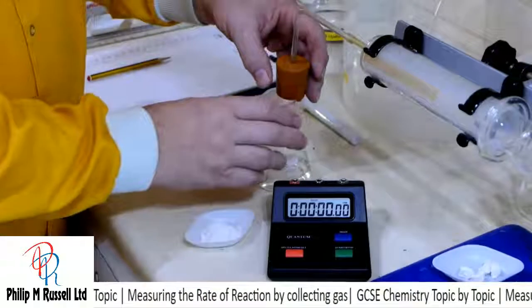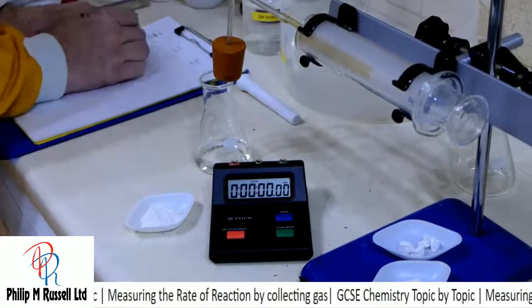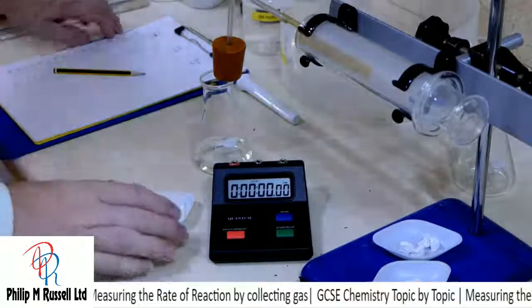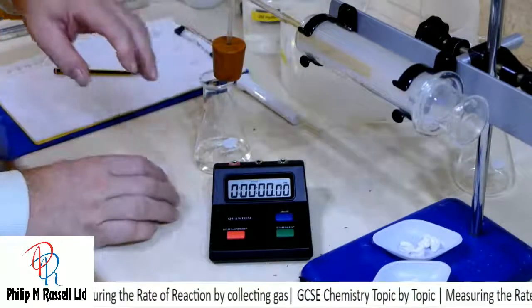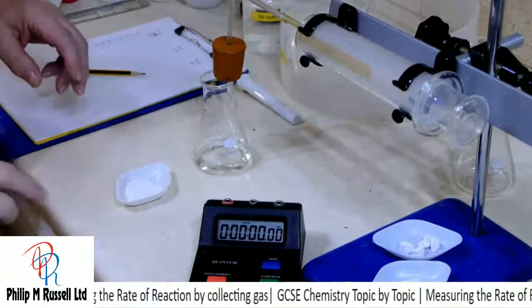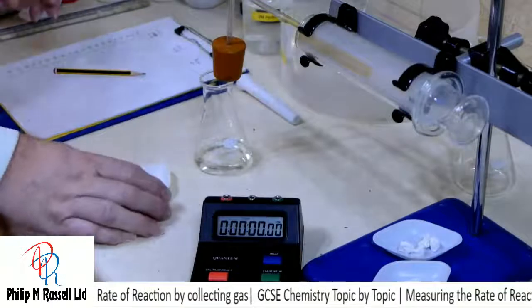So as we start, we know our first value here for 0 is at 0, and we're going to have to be pretty quick on doing this, and I'm going to get Paul to press the start button on the timer when we're ready to go.